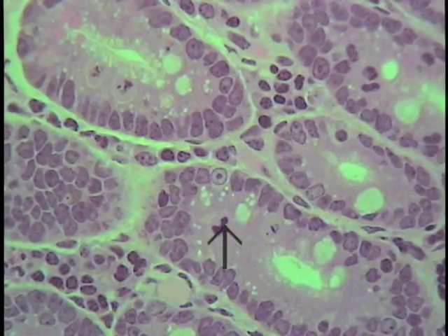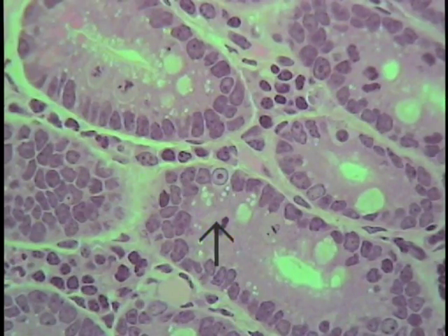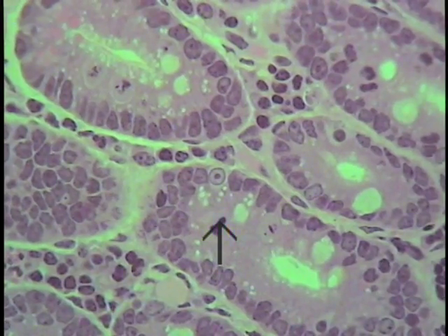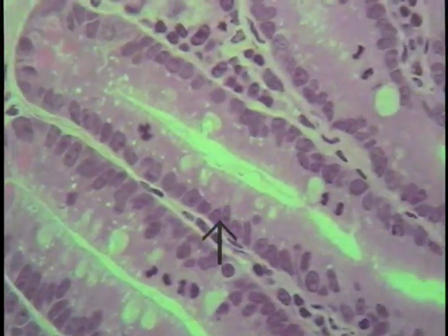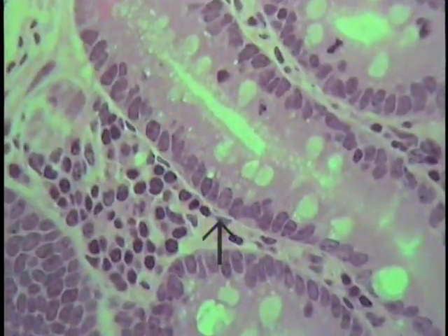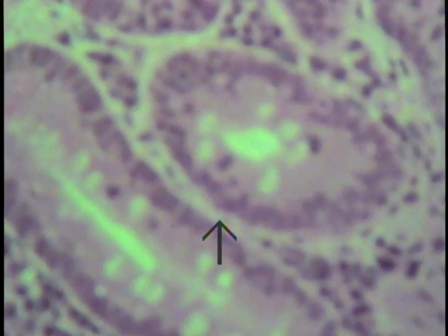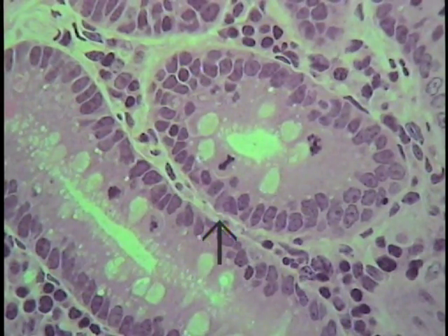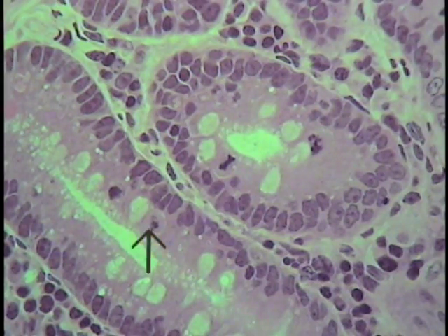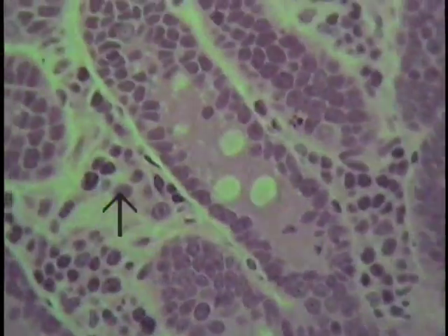Probably a metaphase here, the cytoplasmic boundary being here, and then the chromosomes lined up along an equatorial plate. This is the position and place to look for mitotic figures because of the extraordinary number within these simple tubular intestinal glands. One should familiarize oneself with recognizing mitotic figures and, if possible, put an identification on each one — there are mitotic figures here, one here, one here, one here, as seen in these simple tubular glands.